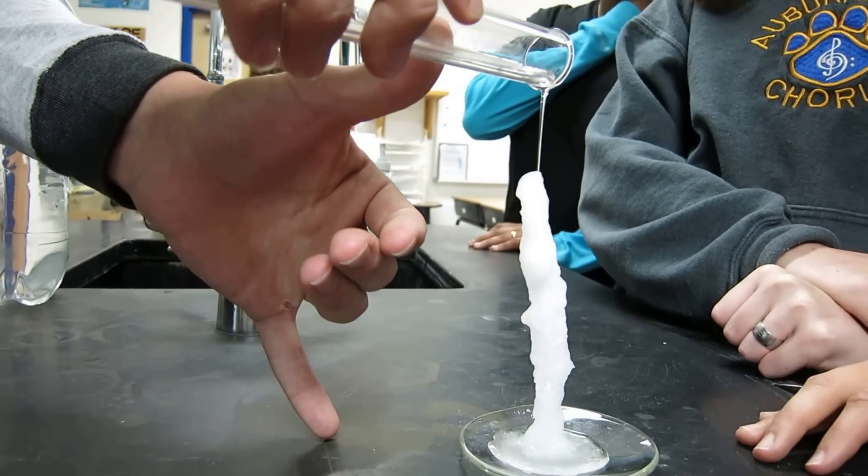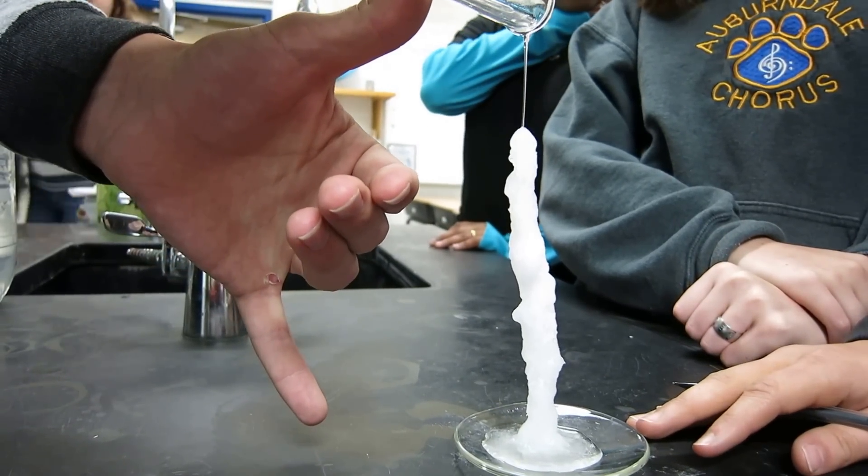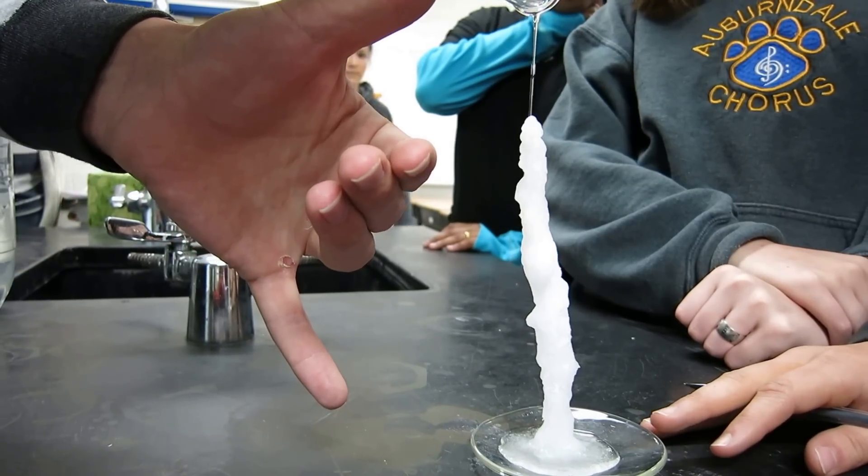Brandon, I think you're going to win the award for the tallest sodium acetate tower. Class award? Is it hot? Let's not touch it. I don't want it to flip.